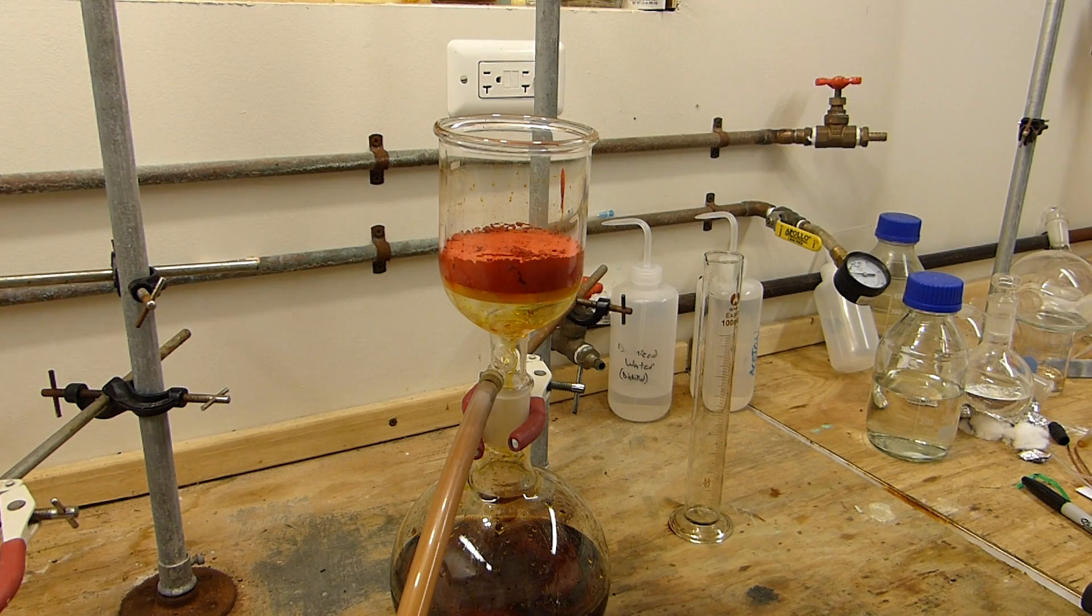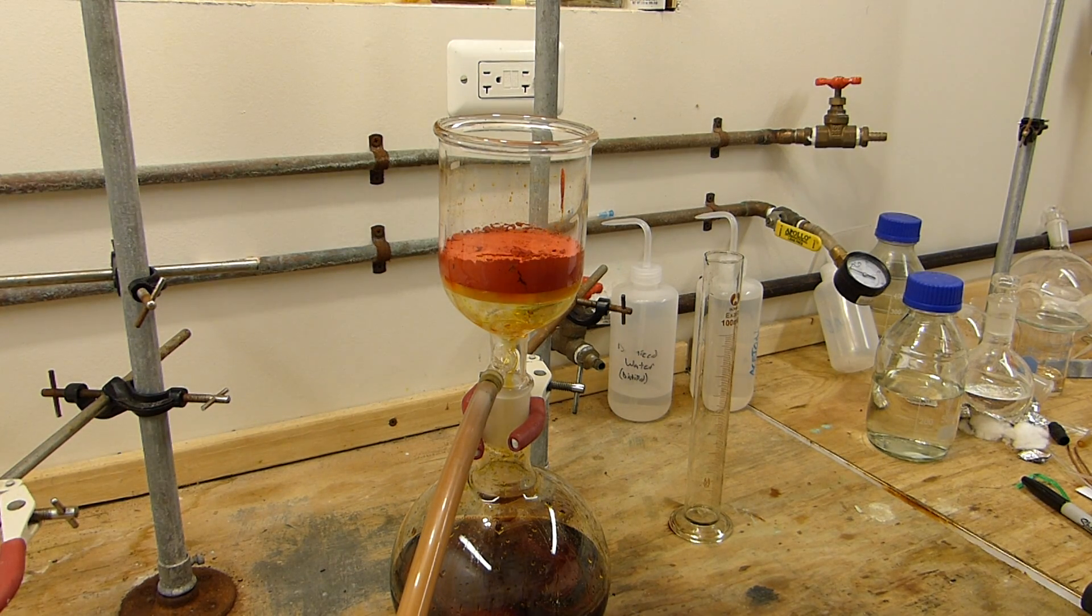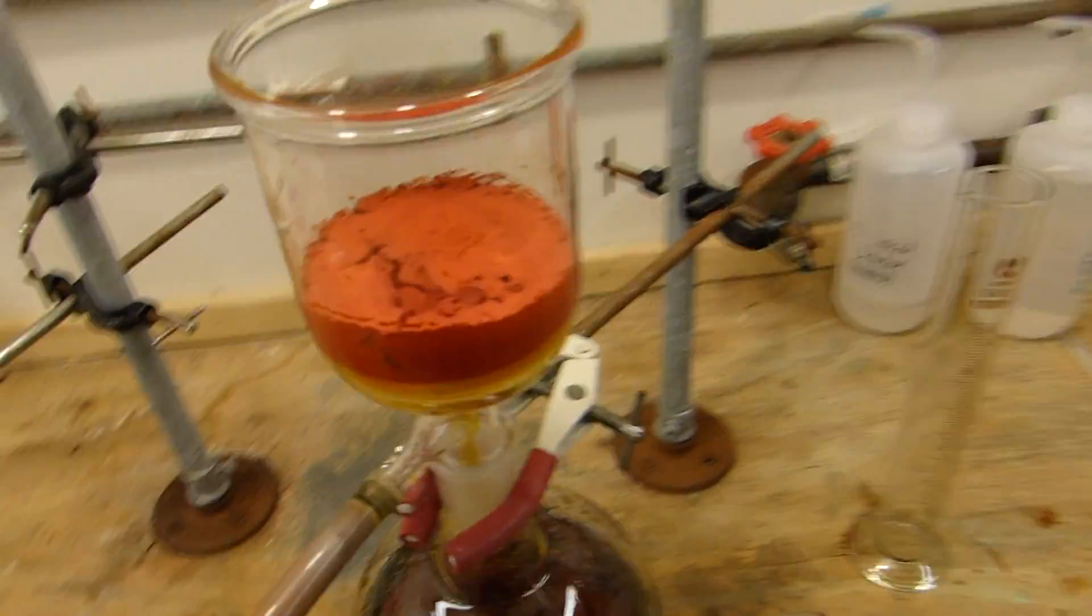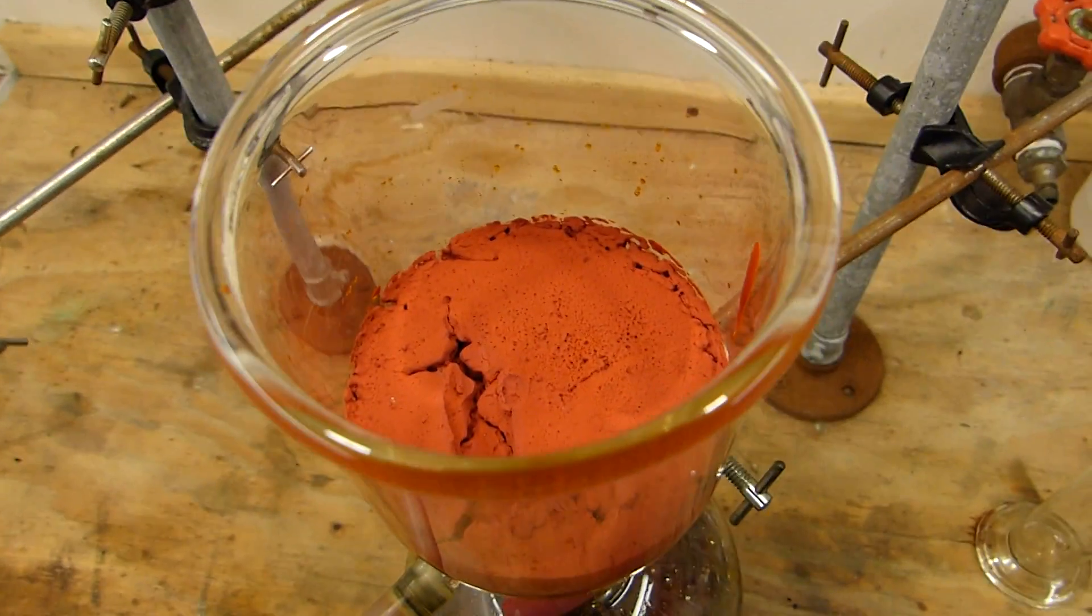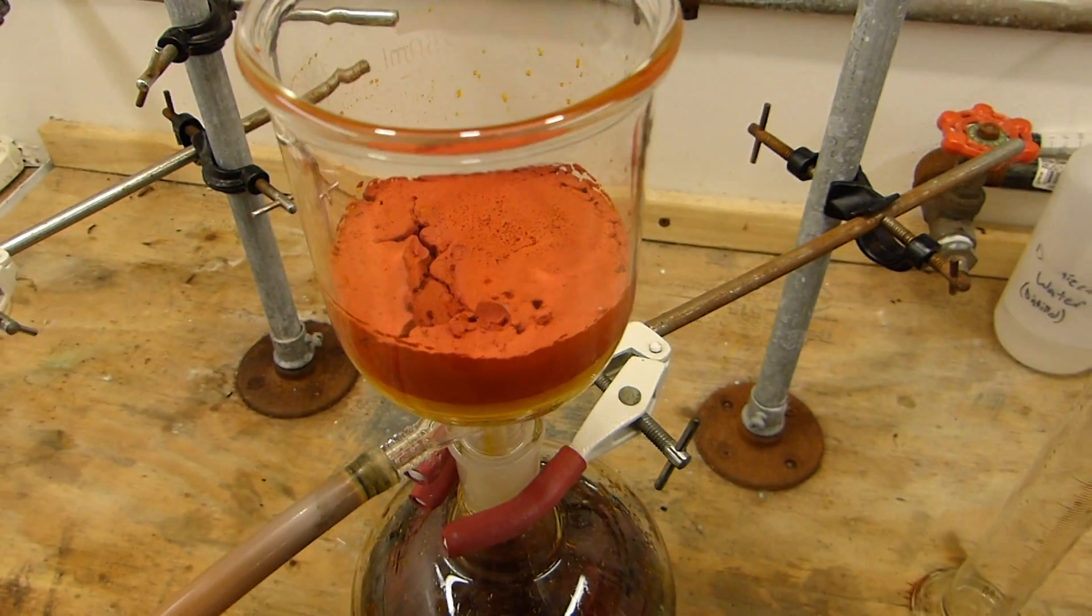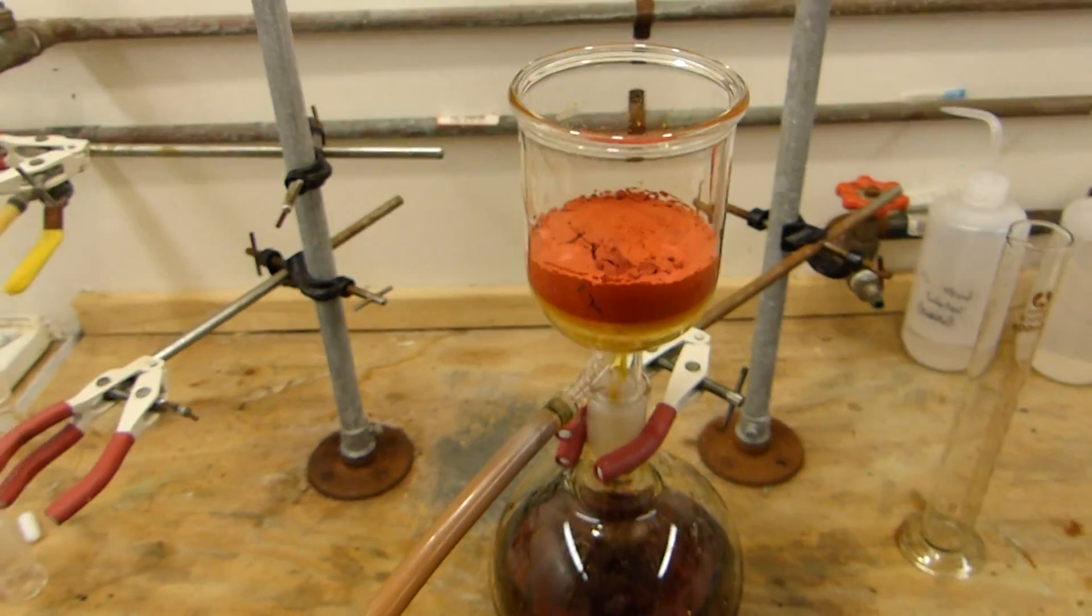It's been on suction for about 10 minutes now, so I'm going to turn off the aspirator. I think it's pretty much dry, as you might be able to tell. Well not dry, but dry enough for us to be able to scrape it out and dry it on a plate. So I'm going to go ahead and do that.